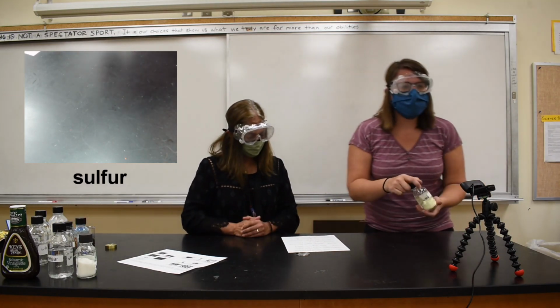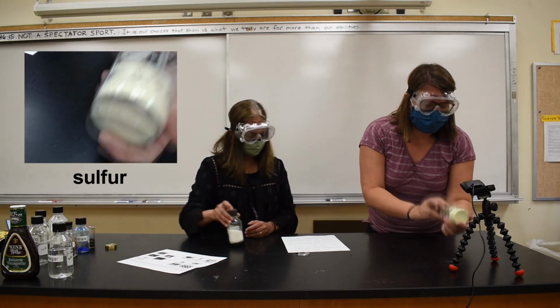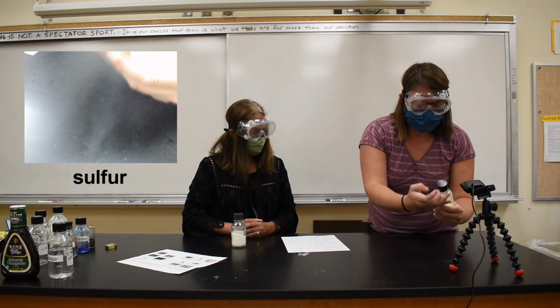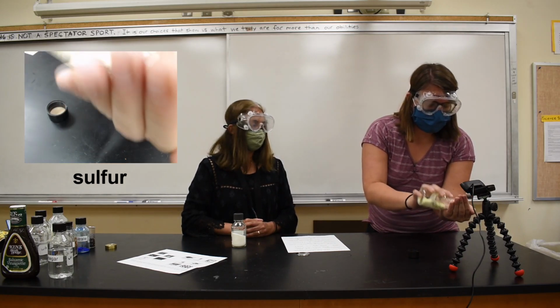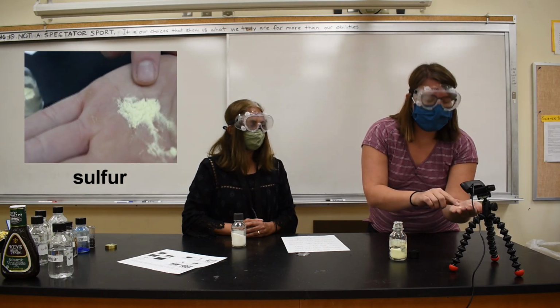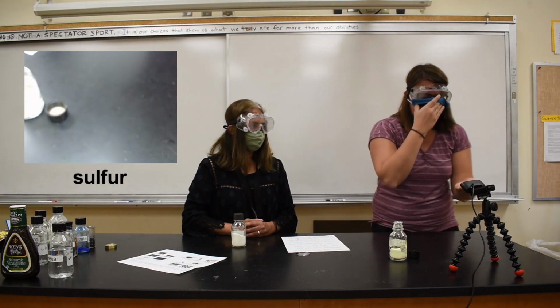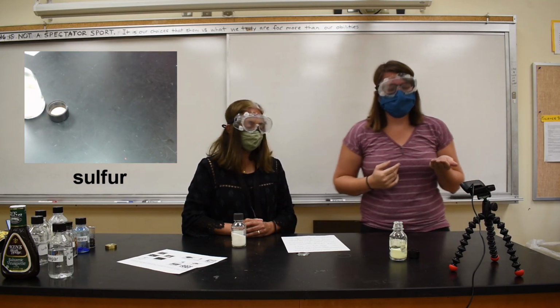Next is sulfur. It's pale yellow. It's a pale yellow powder. Oh, the smell here. I don't know if some of you might know what it smells like. Let me put a little bit out on my hand. Very, very fine pale powder. And it smells a little bit like rotten eggs.